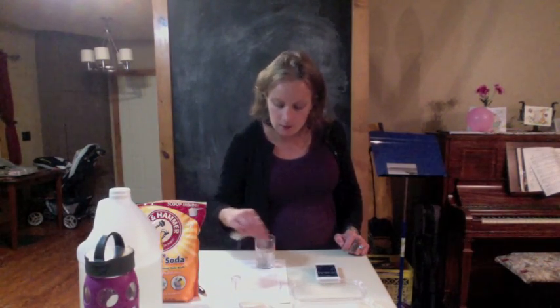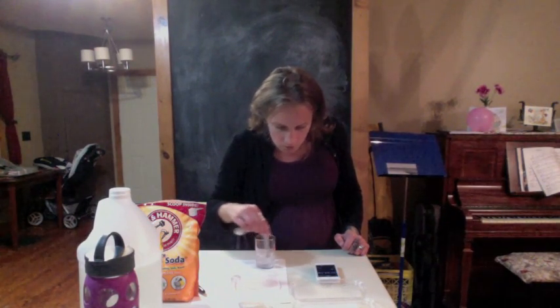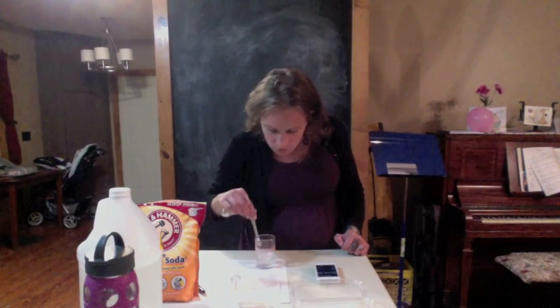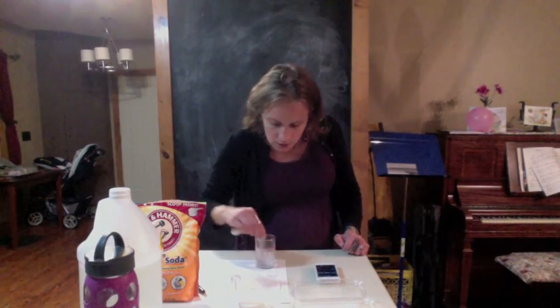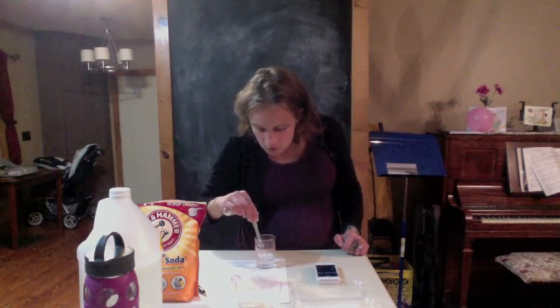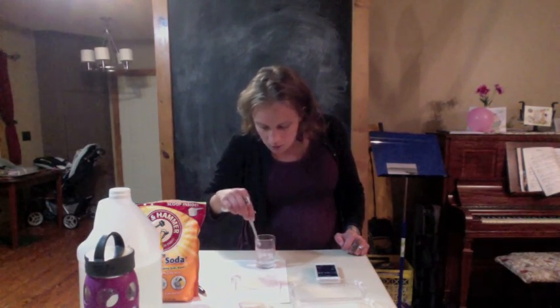Still hearing fizzing. If you stir it and you hear fizzing, it's not quite done. Okay, I'm going to call that done. That took 1 minute and 3 seconds.